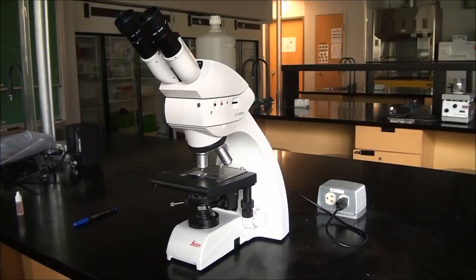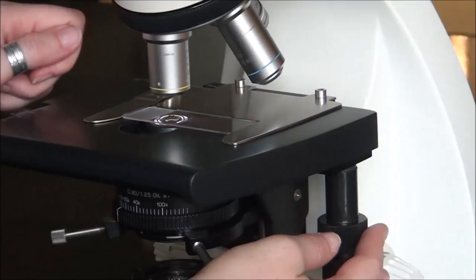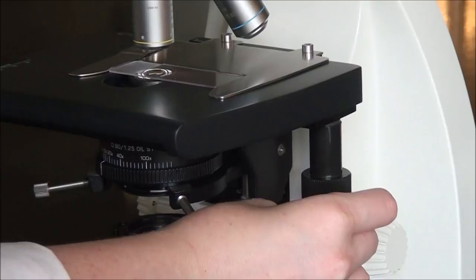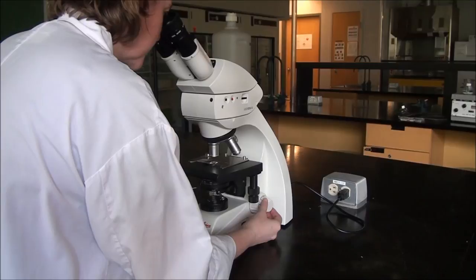Now that we have Köhler illumination set, we're ready to focus on our sample. The good news is we're already focused on the top of our slide because we have that orientation mark. Now we need to find our sample, so we're going to go to our XY adjustment knobs. There's something there that isn't quite in focus, so look through your ocular lenses and then with your fine focus knob, adjust it a teeny tiny bit.